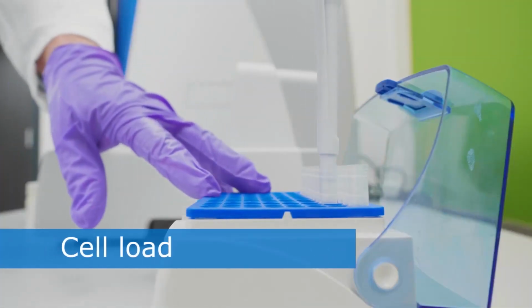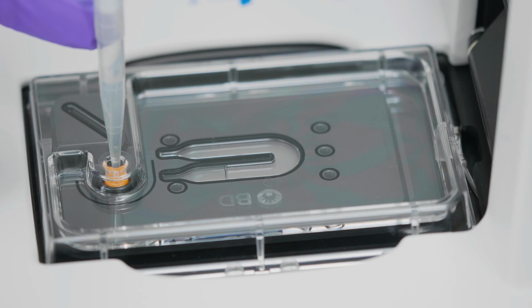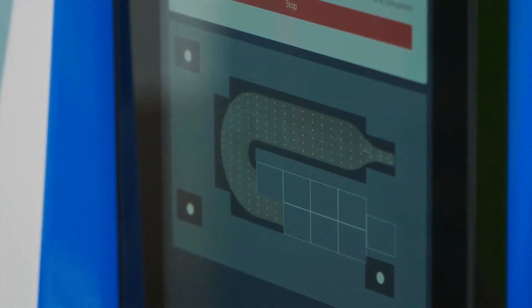Using the electronic pipette with the program optimized for cell loading, the sample is injected into the cartridge. To monitor the efficiency of this step, the cartridge is scanned just within a few minutes. The image shown reveals single cells collected in single wells. In order to minimize cell doublets, the cartridge is loaded to a maximum of 10% of its full capacity.